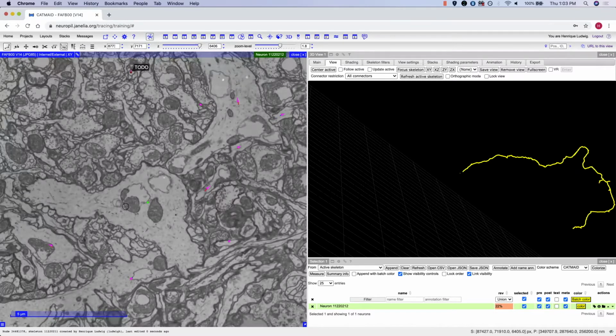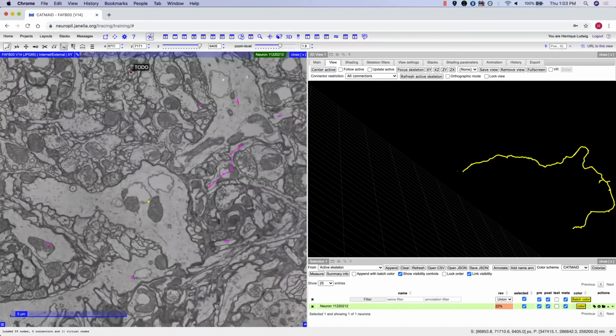When tracing and coming up to a branching point like this, be sure to place only the necessary amount of nodes on the screen. In this case, I will only be putting down one more node. If you do not intend on tracing this part of the skeleton out, then place a to-do tag down.